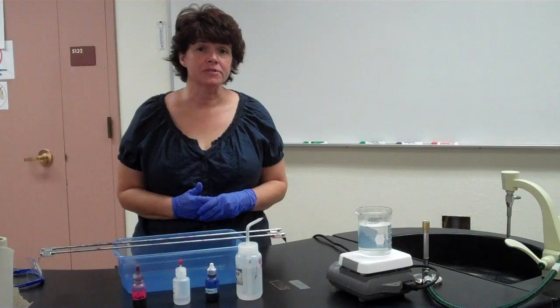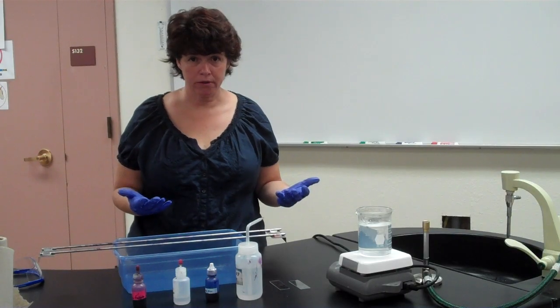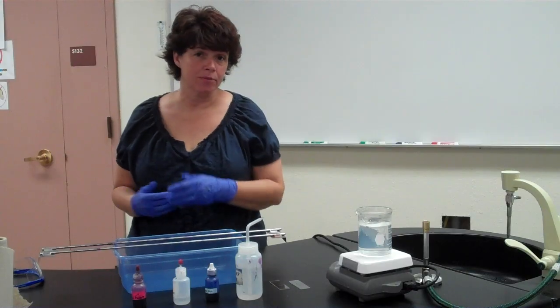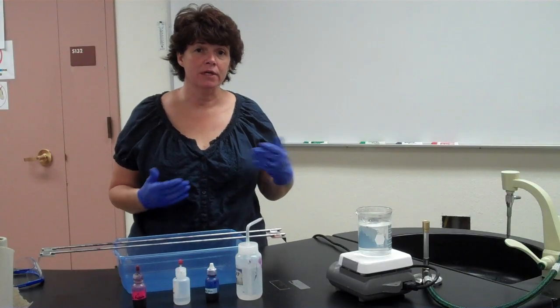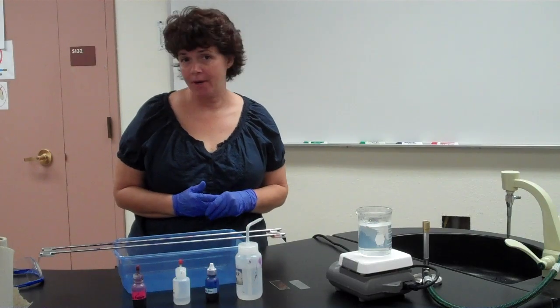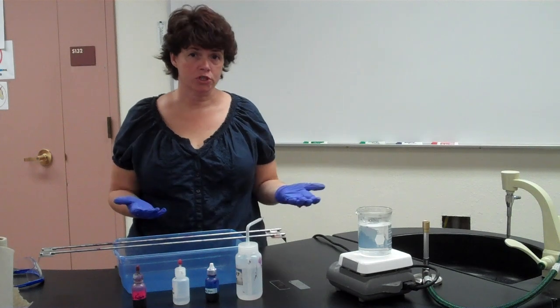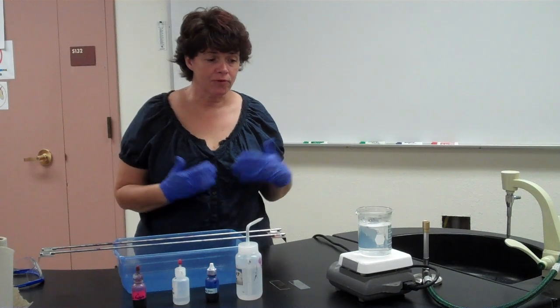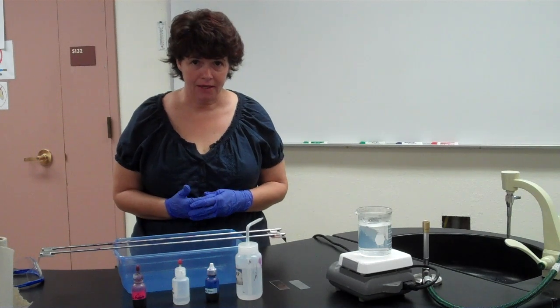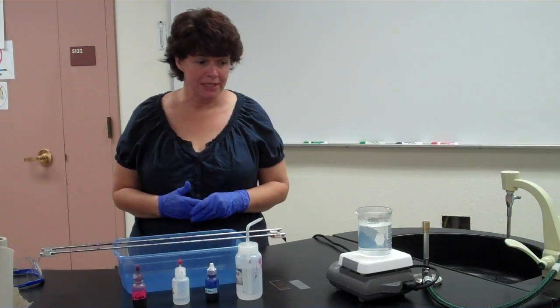Now, just like it sounds, acid-fast bacteria will retain their wall components, therefore retain the primary stain even when washed with acid. Okay? Other bacteria that don't have that mycolic acid, if you were to put the acid alcohol on them, it's going to wash off. Okay? Now for the acid-fast stain, we're going to do something a little bit different than we did with the Gram stain. We're going to use heat.